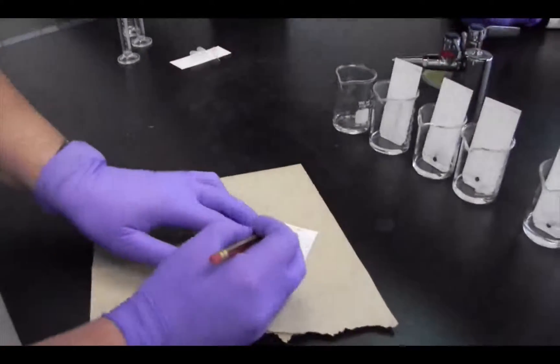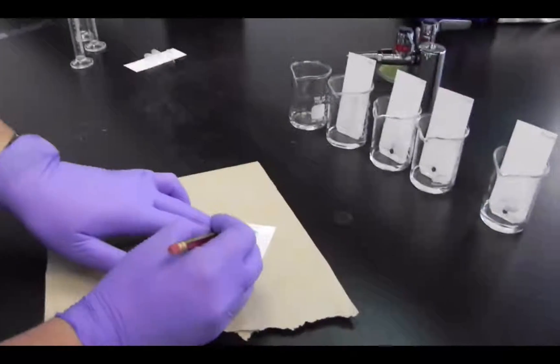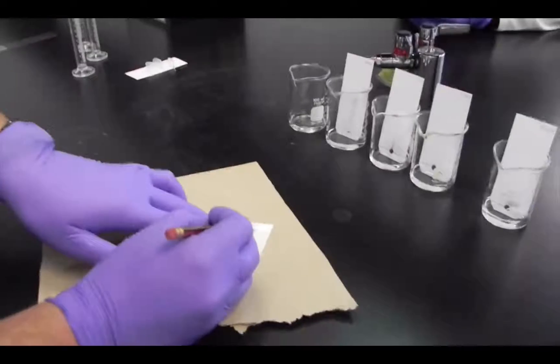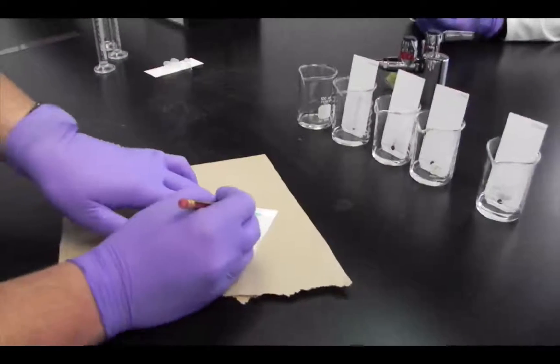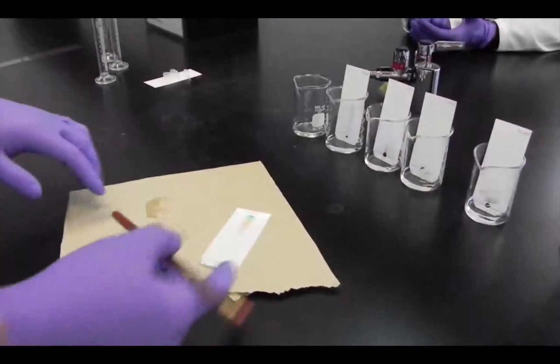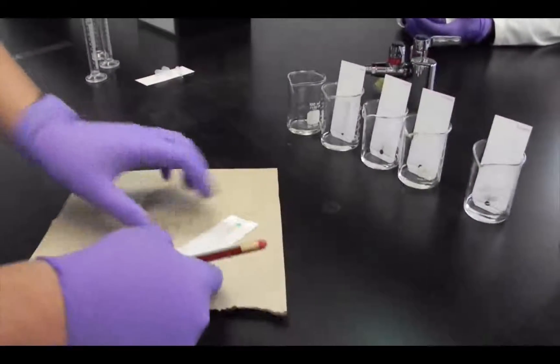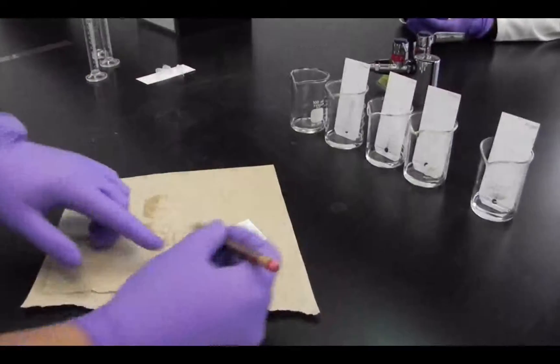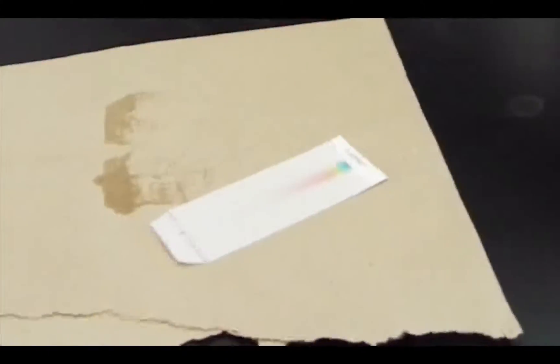Then you mark the limit where the solvent traveled, and this is going to help you to calculate your RF.